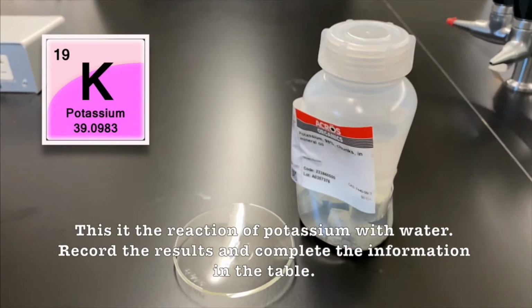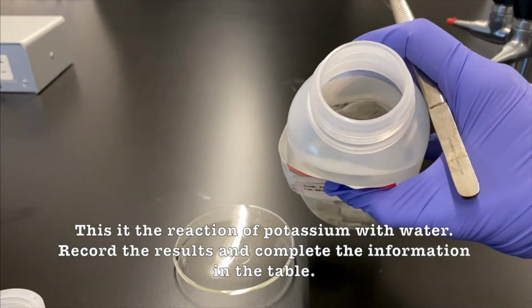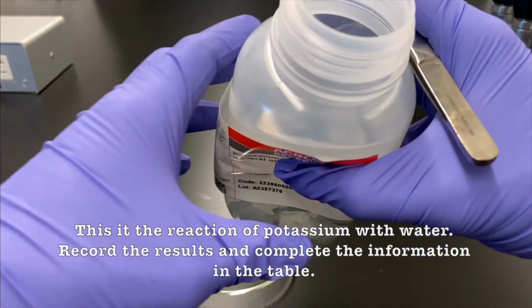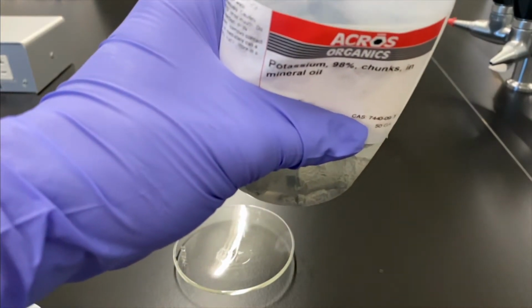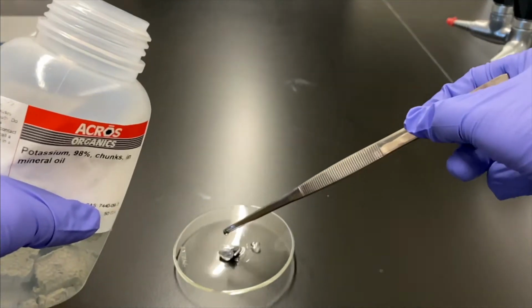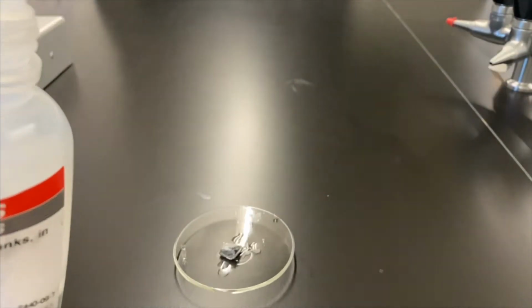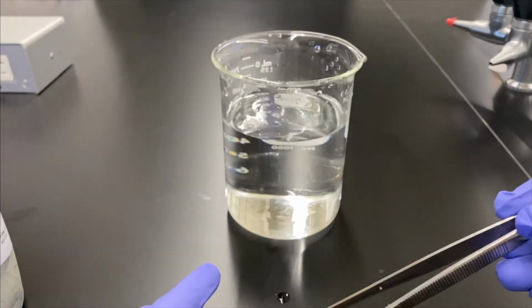All right, so now we're going to do it with potassium. Usually if you guys were in the lab, we'd actually have the lab instructors do this. Thankfully, we're two lab instructors, so we could do it on our own. And you'll see why in a second, why this isn't something that every student can just do on their own. If you're picking up on the trends of this video, periodic trends, we're getting more and more reactive. So my guess is that this is going to be very reactive.